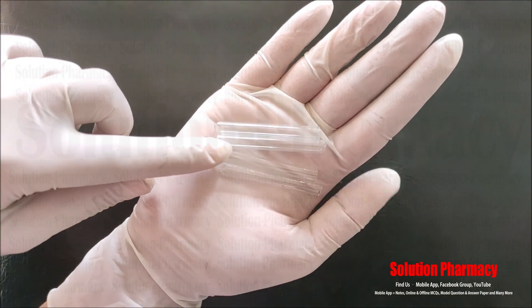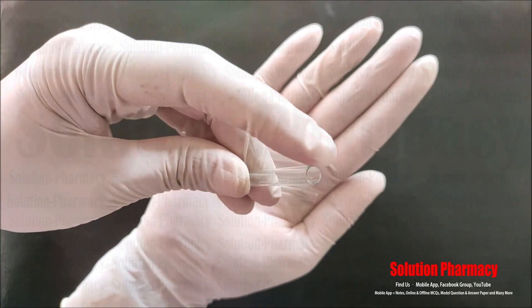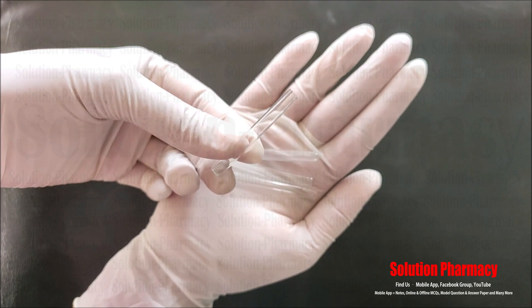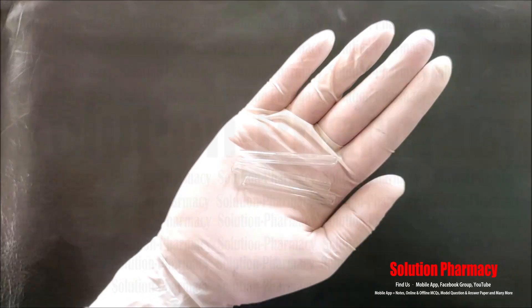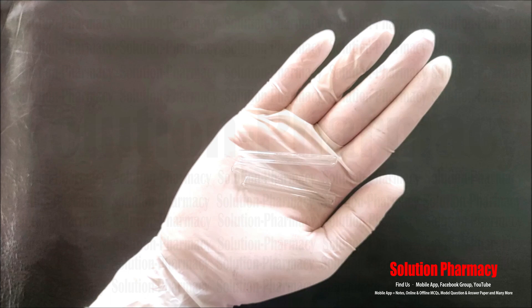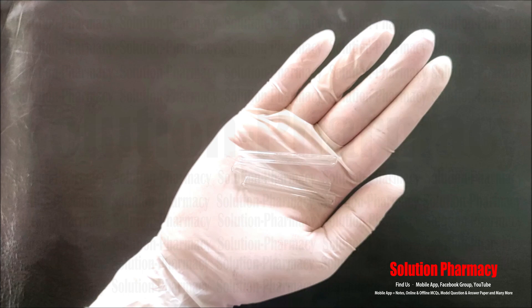This glassware is called a fusion tube. It is very small in size and made of very thin glass, frequently used in the chemistry lab for fusion tests — to fuse or melt a substance. It is generally used in the sodium fusion test for detection of elements like nitrogen, sulfur, and halogens. Sodium metal is added to the sample in this fusion tube, allowed to melt by applying heat, then transferred into water, causing the tube to break into small pieces. It is also used to detect the melting point and boiling point of any substance.